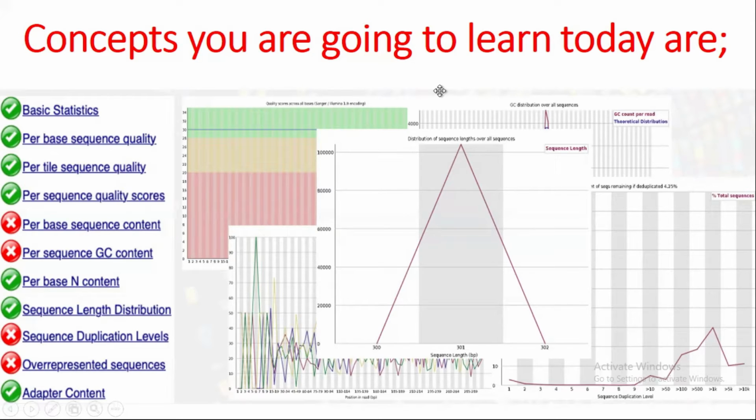Basically, these are the reports of FASTQC. I will discuss the basic statistics, per base sequence quality, per tile sequence quality, per sequence quality, and others. So stay tuned till the end because it's very important. When you understand FASTQC reports, then you can easily pre-process your data using different pre-processing tools. So if you understand it well, you can pre-process your data well.